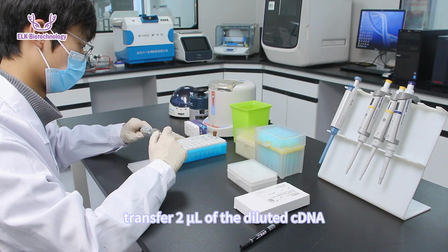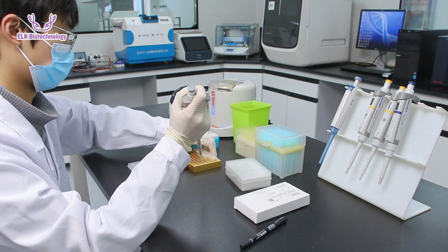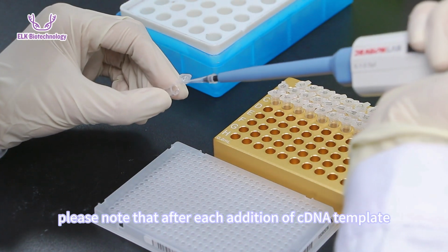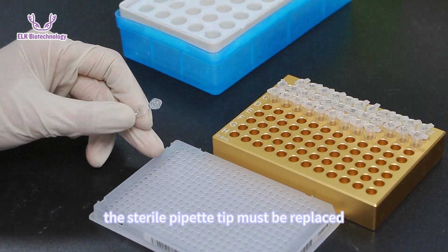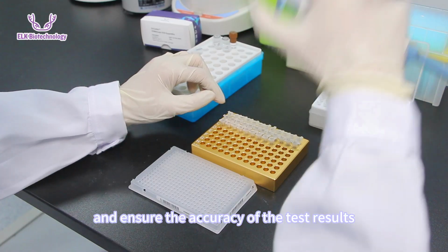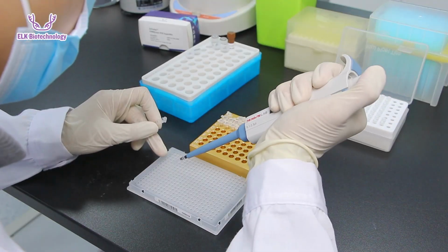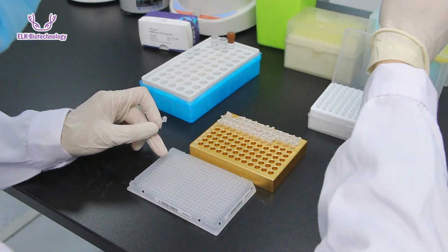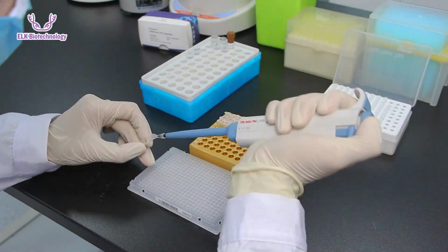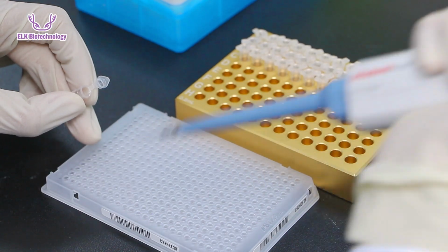Transfer 2 microliter of the diluted cDNA to the corresponding wells. During the experiment, please note that after each addition of cDNA template, the sterile pipette tip must be replaced to avoid cross-contamination of samples and ensure the accuracy of the test results. Use the same step to spot the S gene.